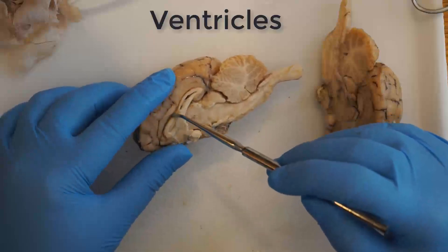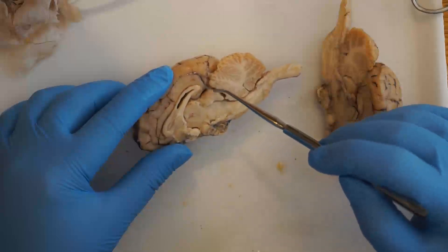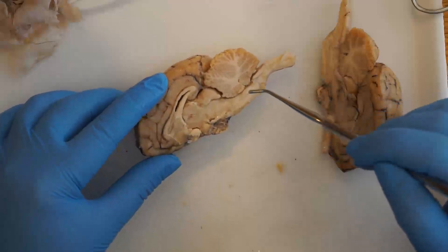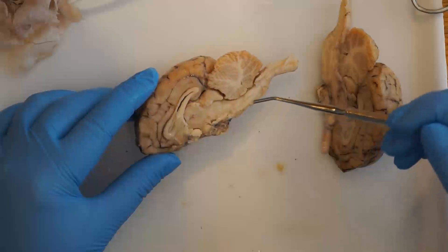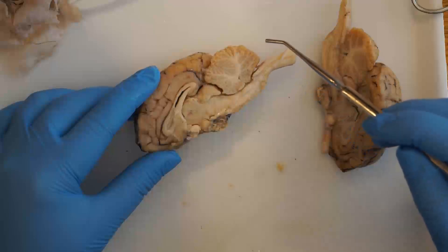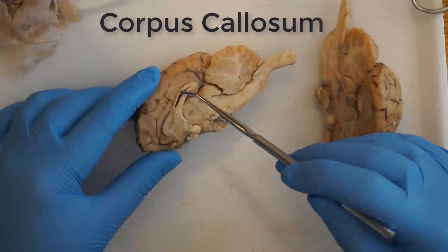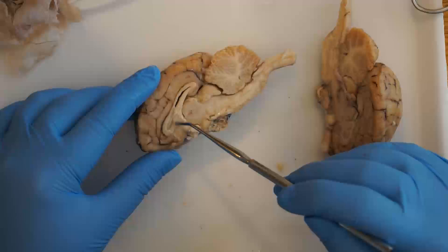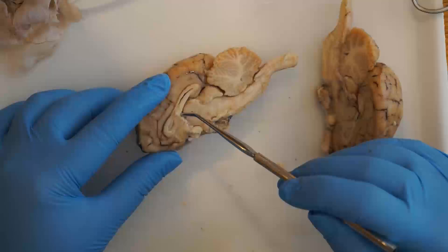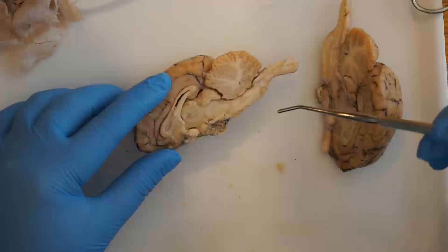Starting with the ventricles, which are the spaces found inside the brain. Those ventricles are filled with cerebrospinal fluid, which bathes the brain and protects it. You should also easily be able to see the corpus callosum, which is the wider, lighter band found near the ventricles, and that's responsible for helping signals pass back and forth between the right and left hemispheres.